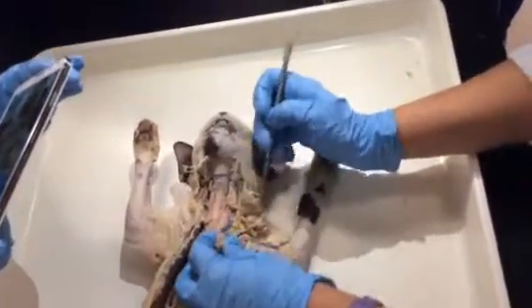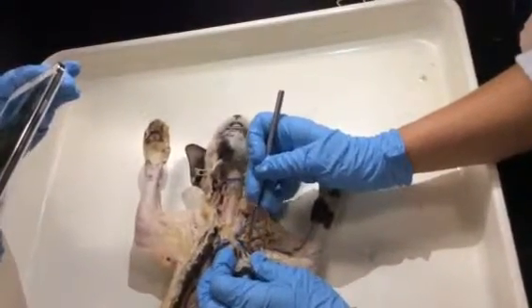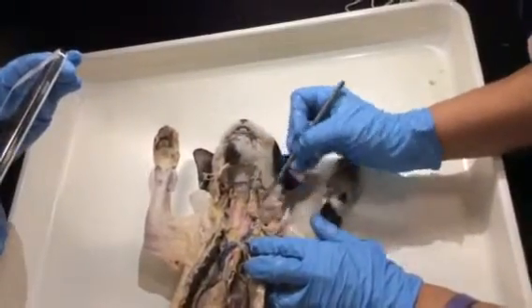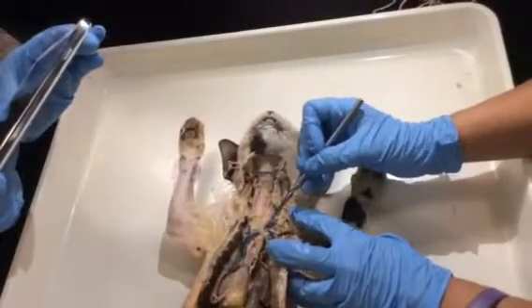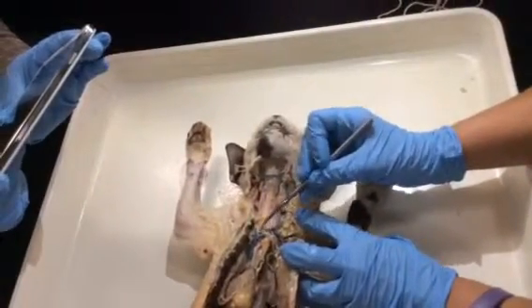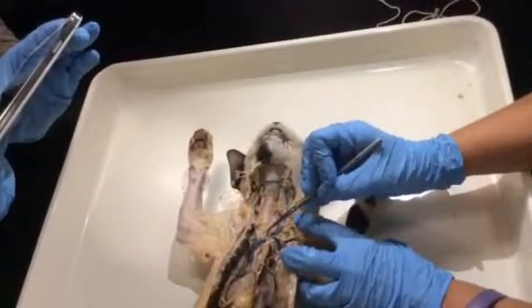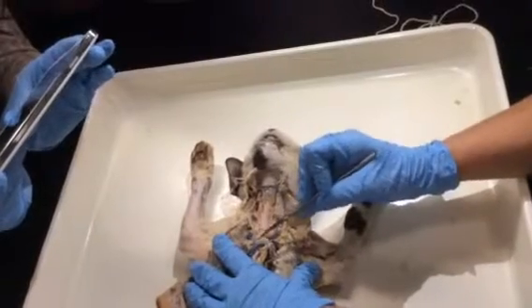Now if you want to follow the blood back, we start with the brachial vein, going into the axillary vein, into the subclavian vein. The subclavian vein together with the external jugular coming from the head go into the brachiocephalic vein, sorry. The brachiocephalic vein is a small little piece here, for the left side, and then on the other side, as you can see, we have the same arrangement.